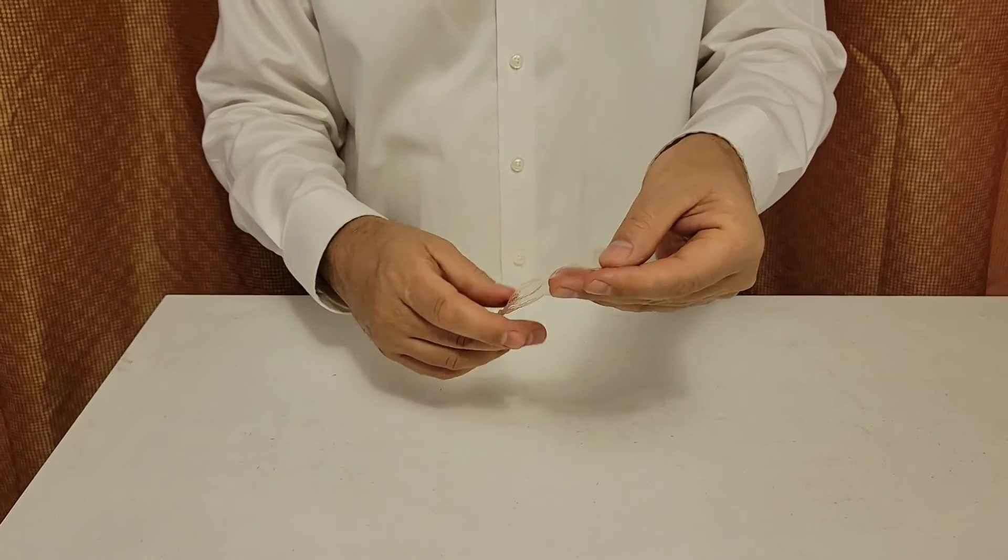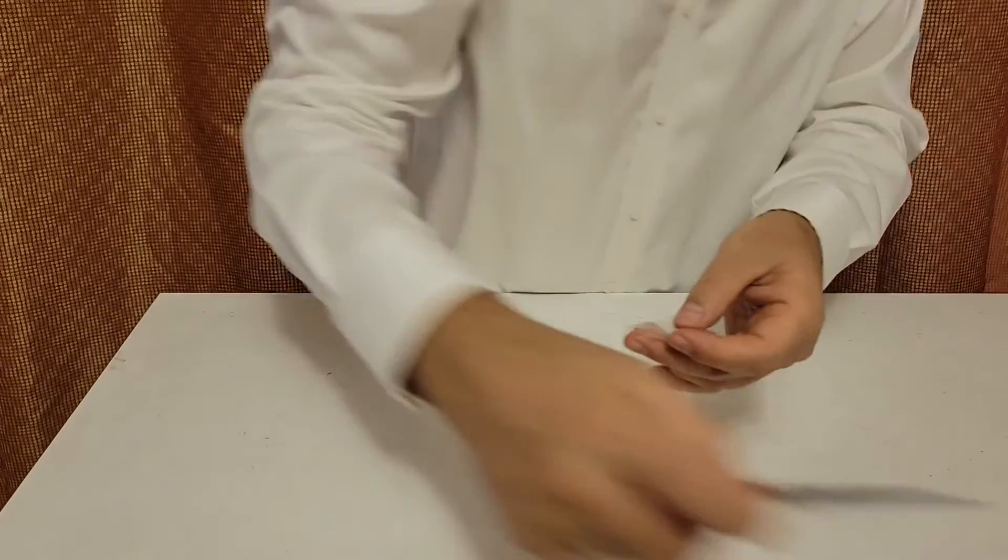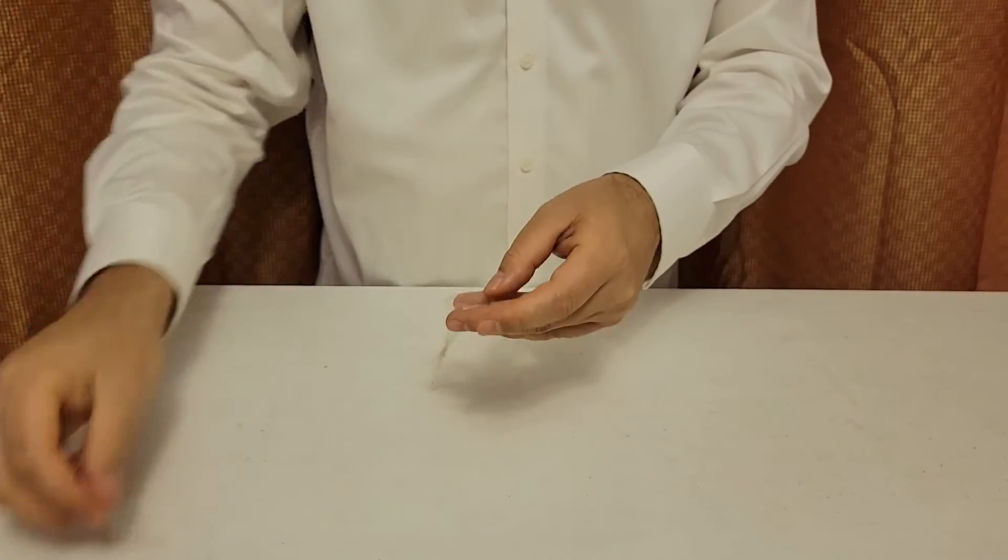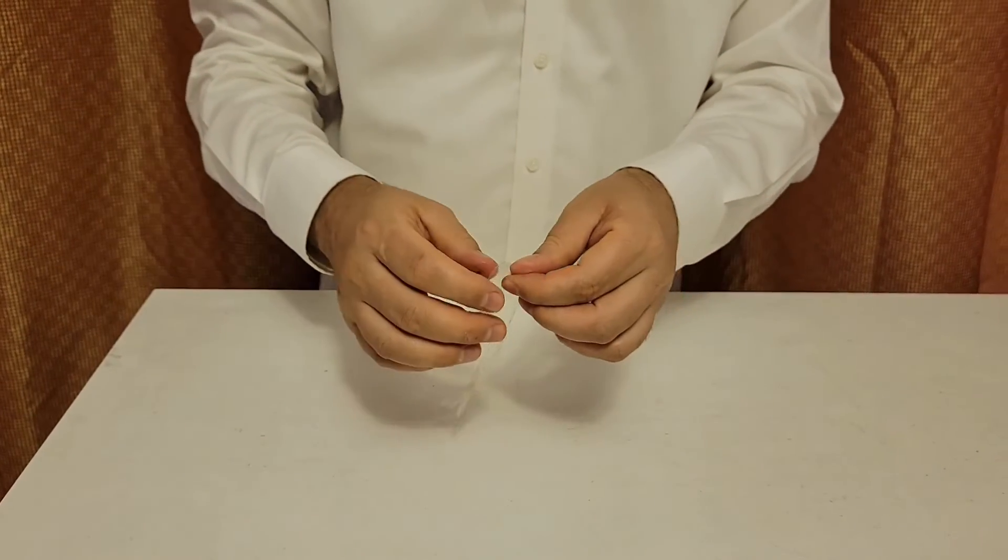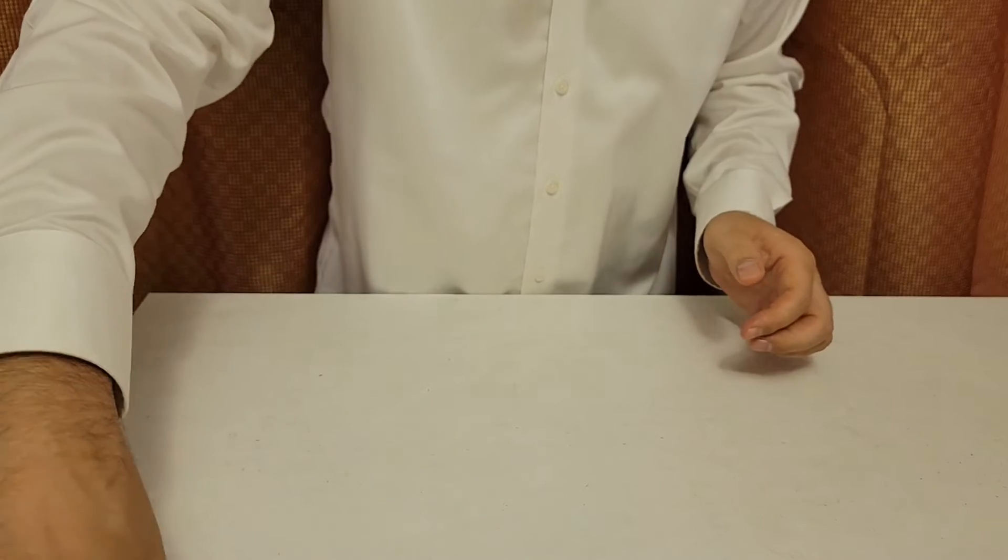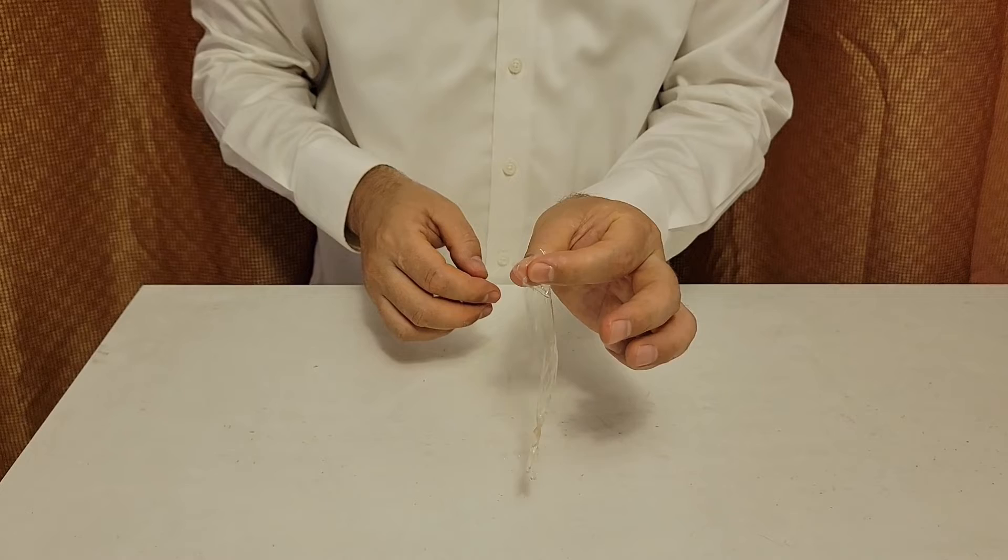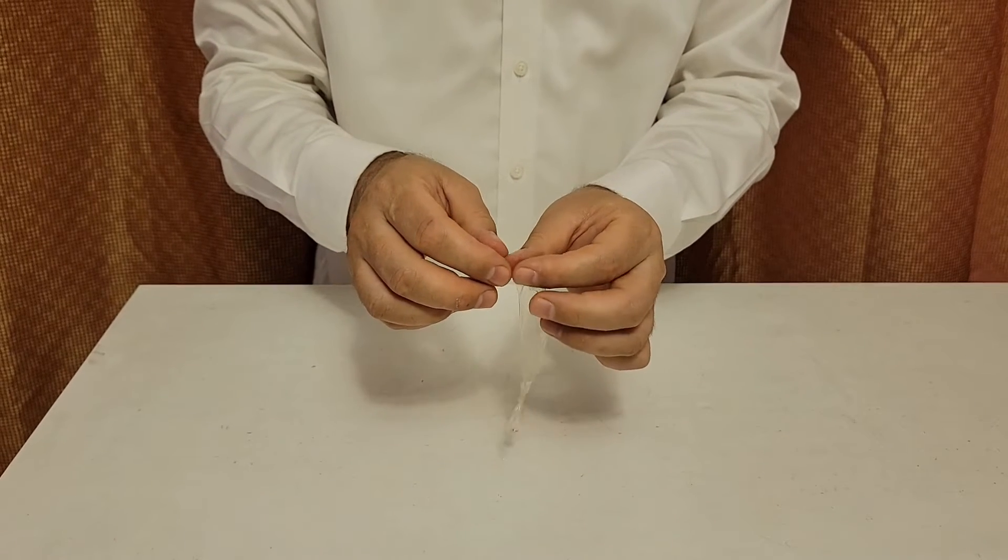Now I think this dialysis tube may be too big. I'm going to trim it a little bit here. And now I will open it. Well, if it doesn't open, maybe soak it a little bit more. And then by moving your fingers like this, you open it up.